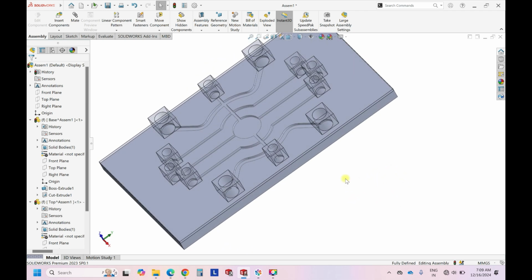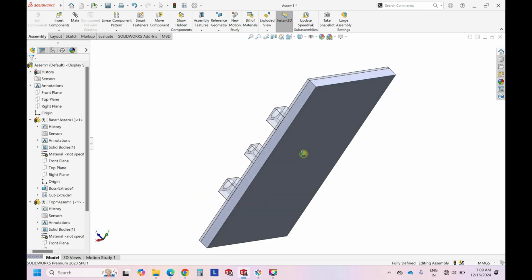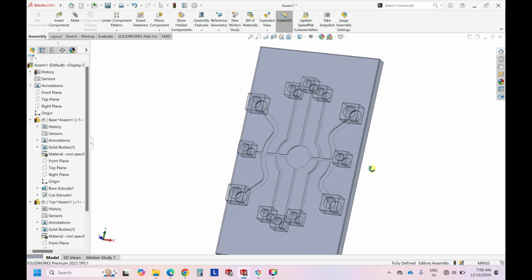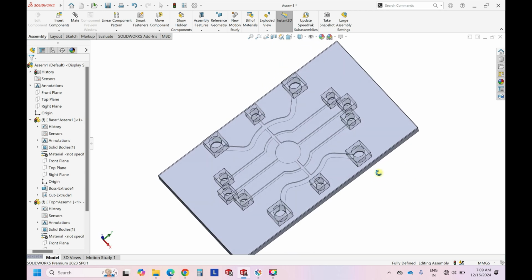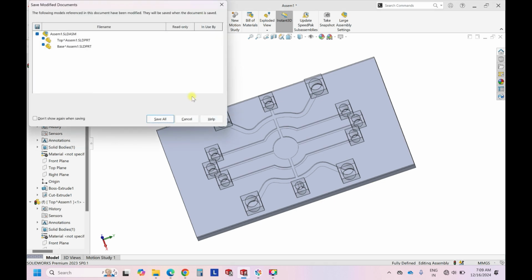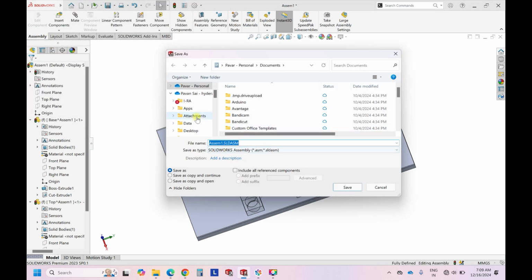So this is how the final design looks. This has 5 inlets, 5 outlets and 2 cross connectors. So simple. It can be saved as the assembly file, and save all the assemblies as internal things.